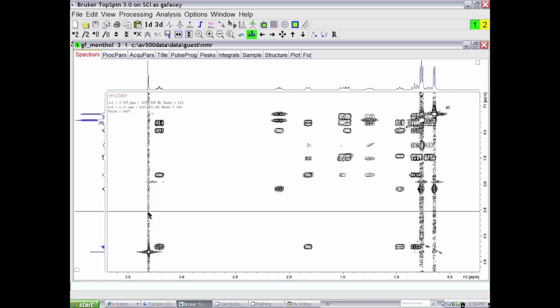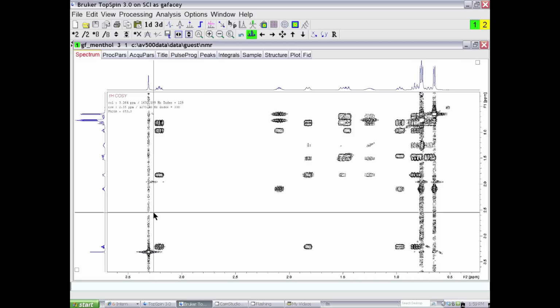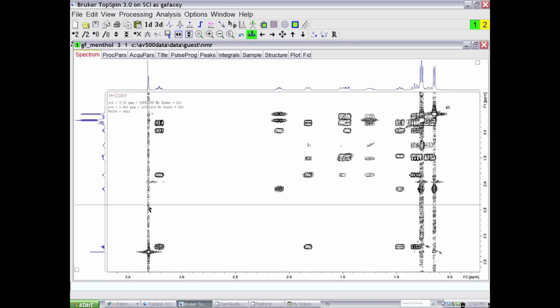So in the cases where there's a stripe of T1 noise here, we can see that there's essentially no response here, or a very low response. There's a noise response here where the cursor is. So I'm taking the smallest response, I'm throwing away the noise, I'm putting the smallest response there. So effectively I'm getting rid of that stripe of T1 noise.